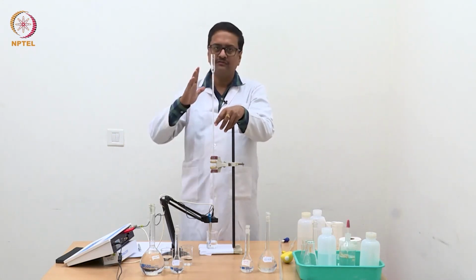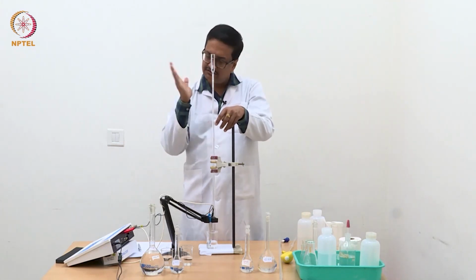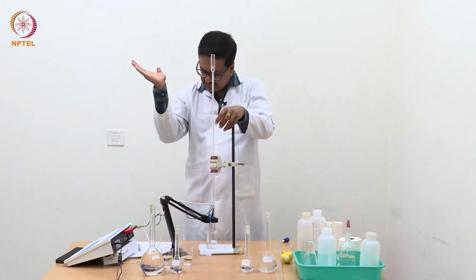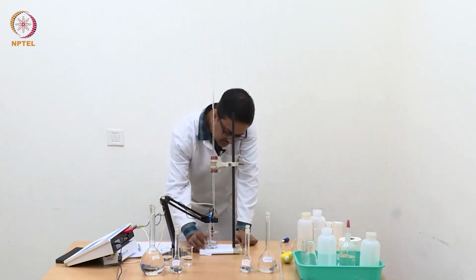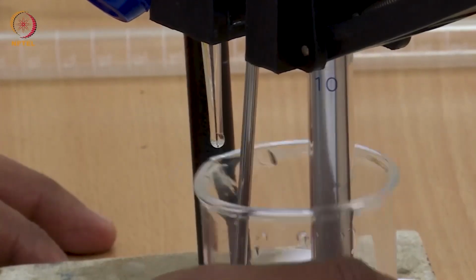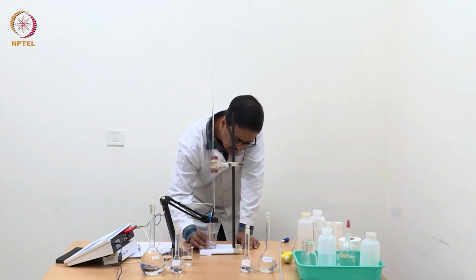So the slope of the line before the equivalence is steep and the slope of the line after the equivalence is not that steep. So we need a few points to get the correct slope. Of course, you should remember that all these experiments have their own experimental errors, and that also involves human error as well.